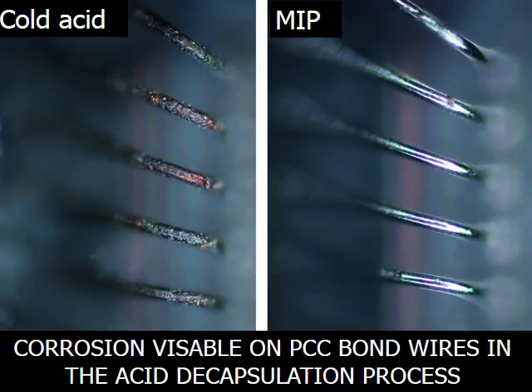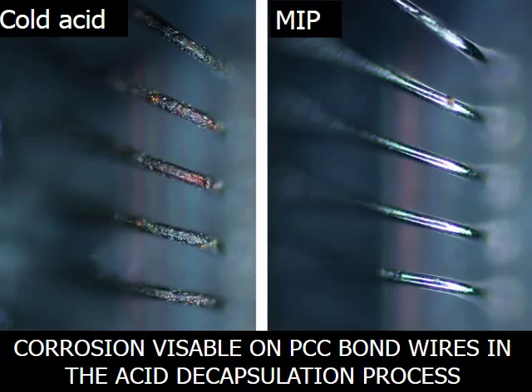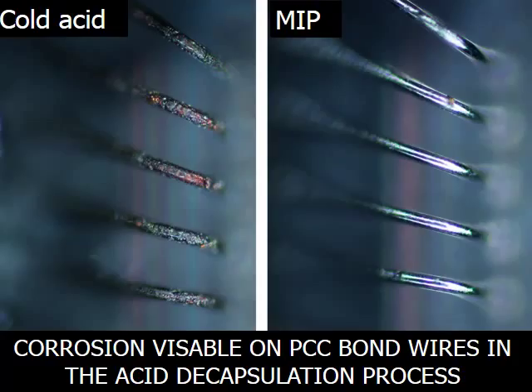These images show a direct comparison between the palladium coated copper bond wire surfaces of the samples. The cold acid decapsulated samples show visible corrosion on the copper bond wires. The MIP decapsulated sample shows no process induced damage, meaning the sample is now ready for further root cause analysis.